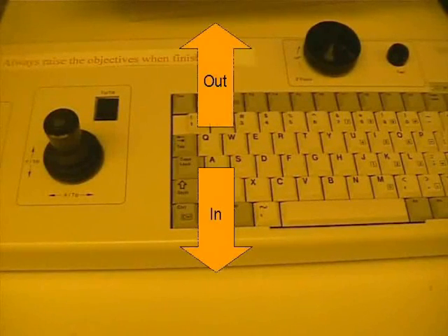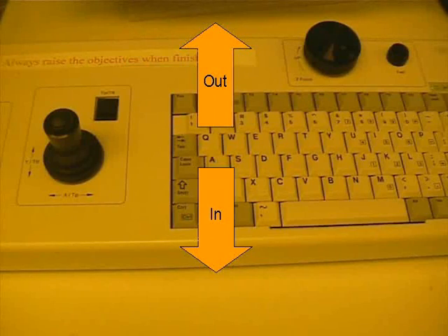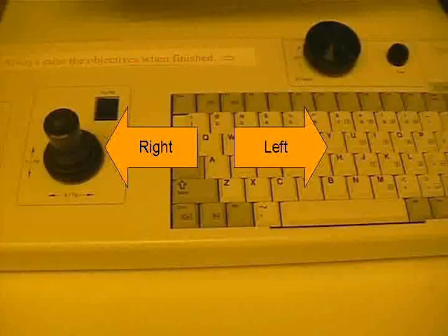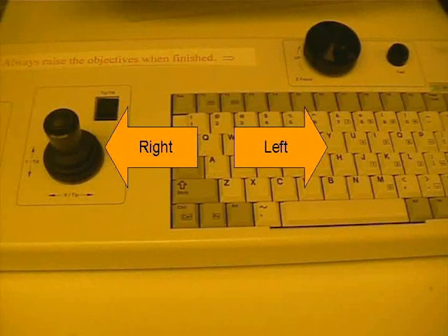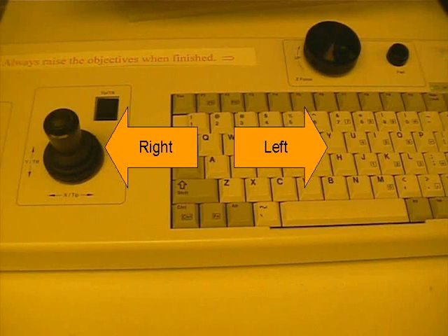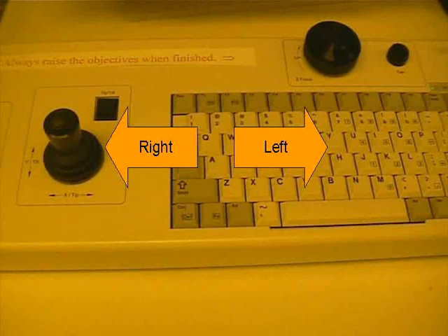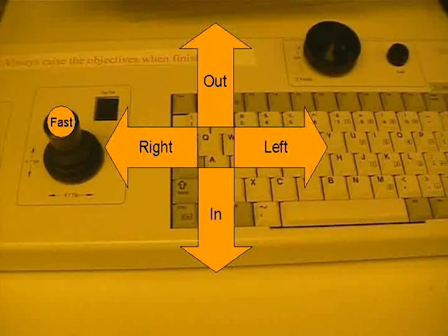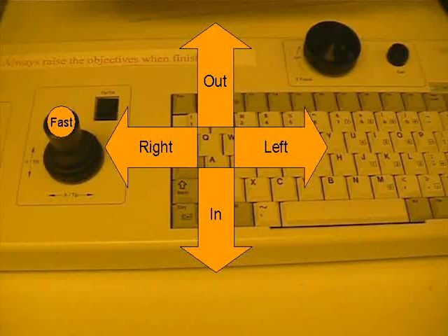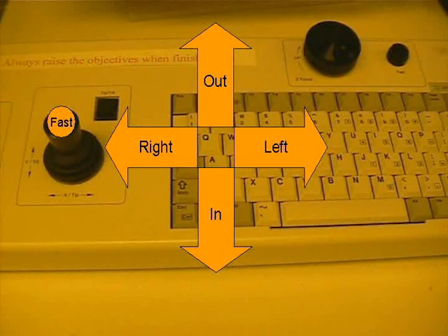We move the stage by moving the joystick. Pressing up on the joystick moves the stage out and vice versa. Pushing right on the joystick moves the stage left and vice versa. You can think of the joystick as actually moving the objective lens. The button on top of the joystick moves the stage fast for coarse adjustment. Tilting the joystick without pressing the button gives fine adjustment.